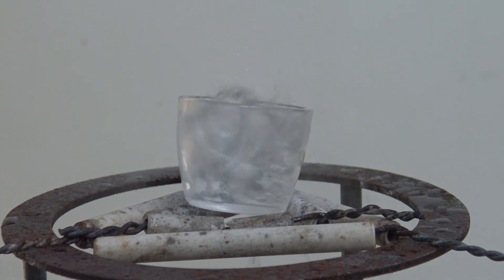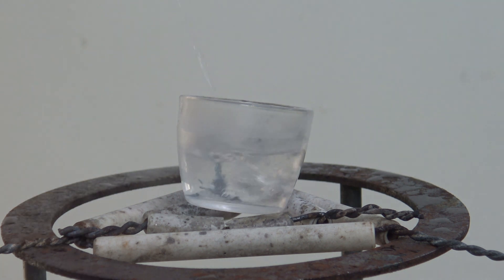My usual beaker would definitely break in this case. This year I worked a lot with alkali metals, so I wanted to get a shot of potassium reacting with water at 100 frames per second.